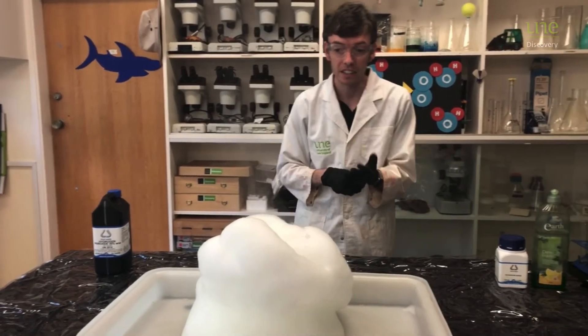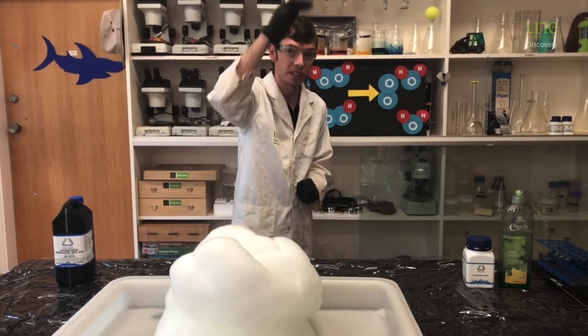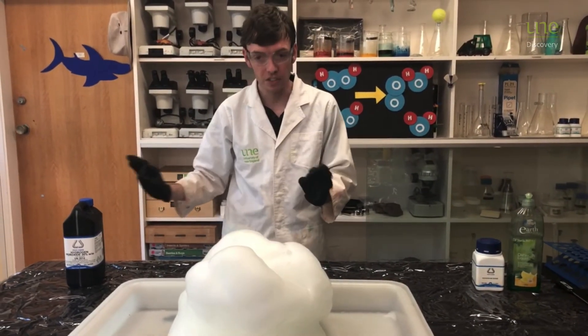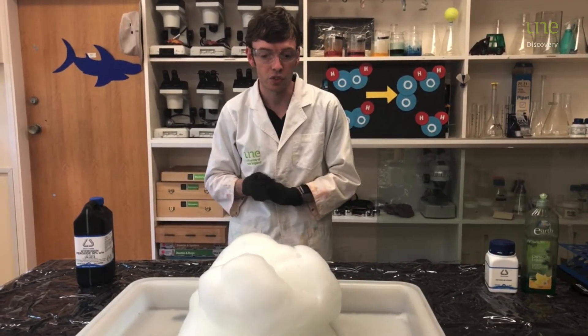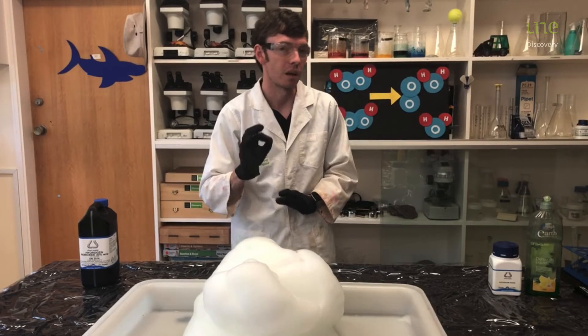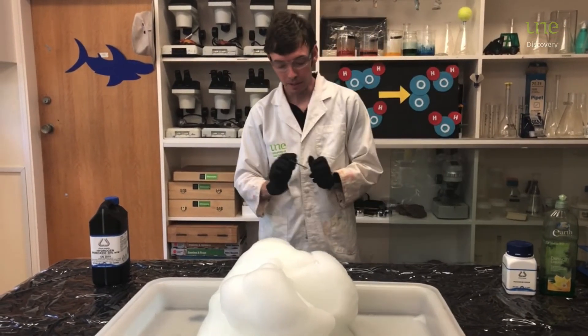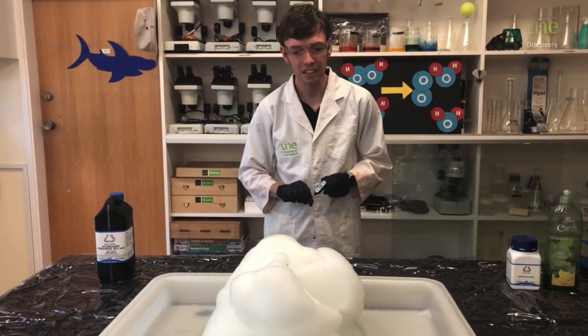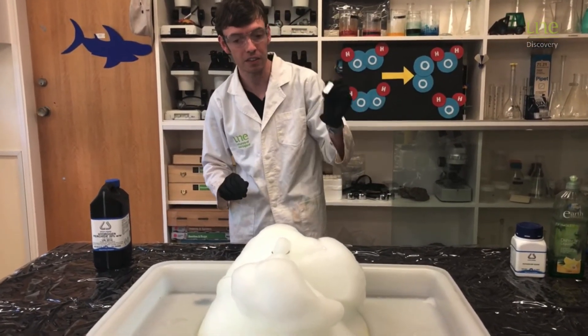So the videos you might have seen online might have had our elephant's toothpaste shooting up into the air. And if you get the mixture of peroxide and the catalyst just right, you can get that to happen. I'm still working on mine. But did you see all that steam coming off the top? I don't know if it's going to show up very well on the video, but luckily I've got a thermometer here.